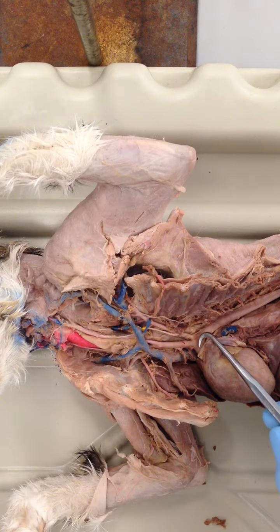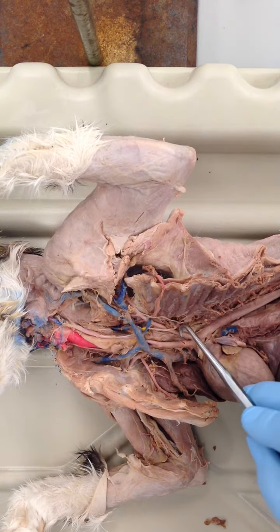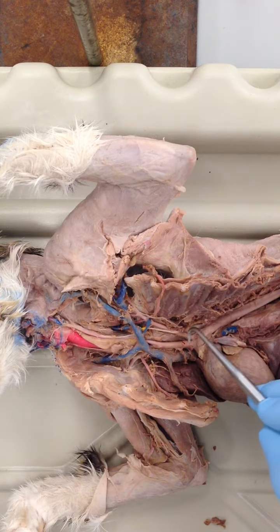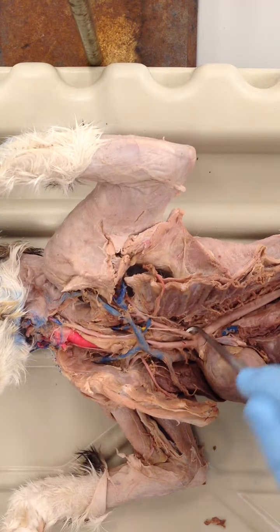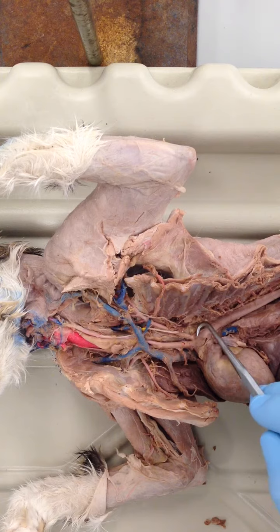From the left ventricle, we see the ascending aorta, and then the aortic arch. Note here there are two branches. We'll start off here with the arteries from the aortic arch. This is oxygenated blood. This is a difference between cat and human: the cats have two branches, the human has three.